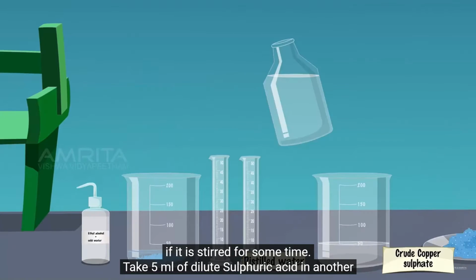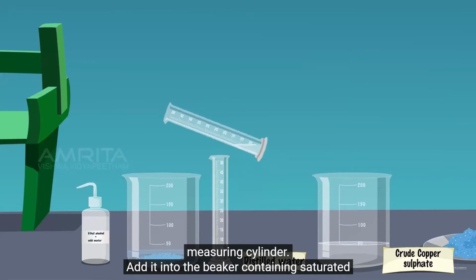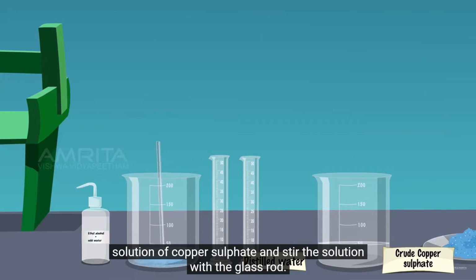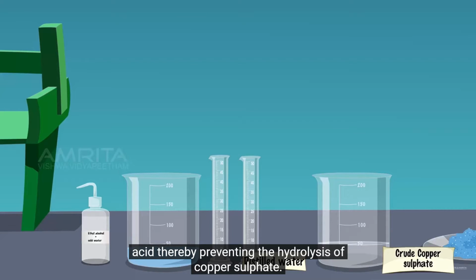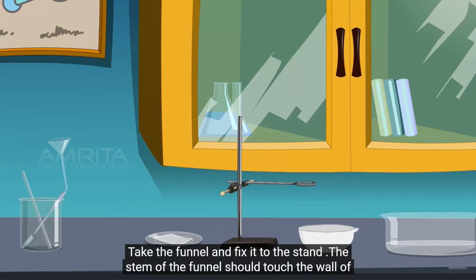Take 5 ml of dilute sulfuric acid in the measuring cylinder, add it into the beaker containing saturated solution of copper sulfate and stir the solution using the glass rod. Observe that the solution of copper sulfate becomes transparent by the addition of sulfuric acid, thereby preventing the hydrolysis of copper sulfate.